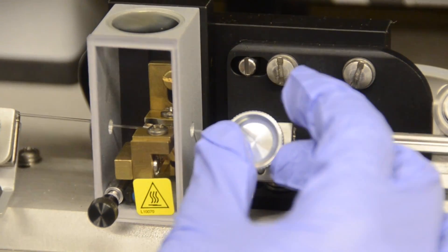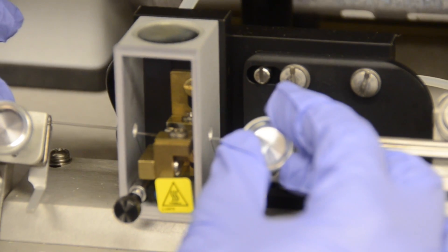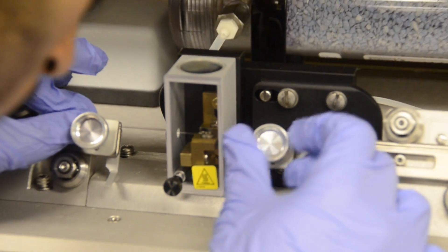Position the tube so that it is centered in the holders and tighten using the screws until you experience a little resistance.